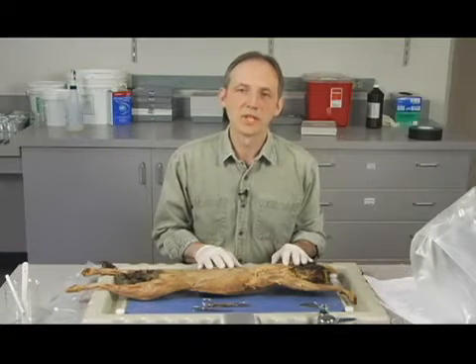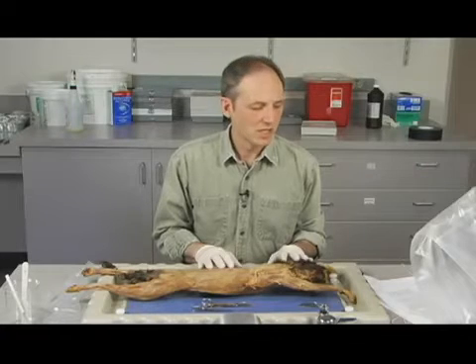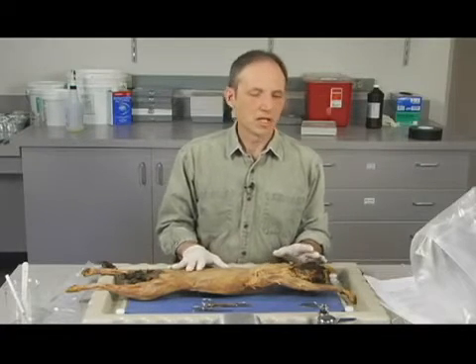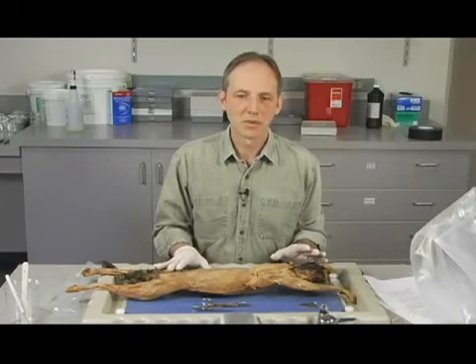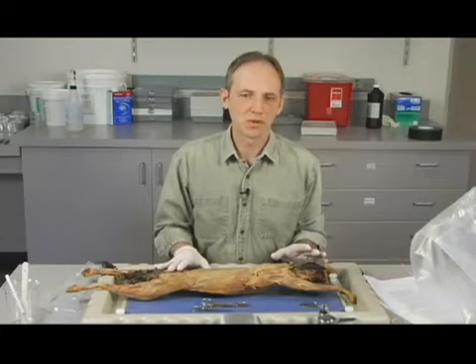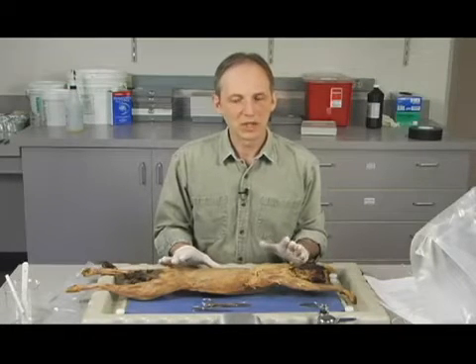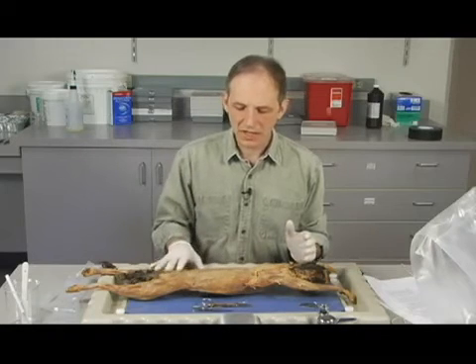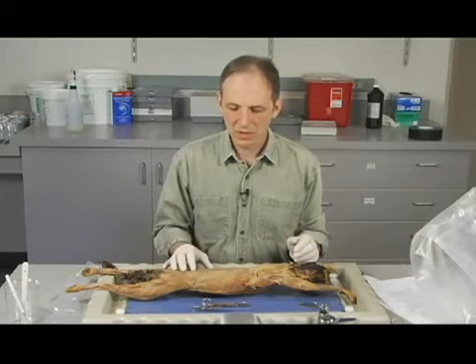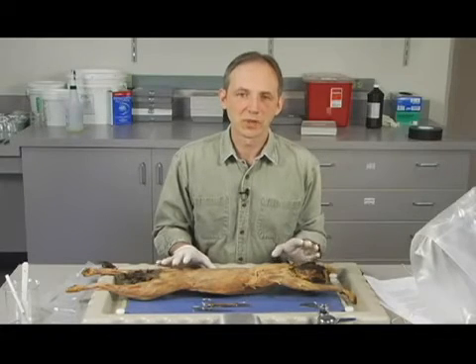You know, you're going to be new at this, and so that's definitely going to impact on how long this takes. Overall, this dissection process that we would do for the muscles would definitely take you several hours. Now, that might be one class period. It may take you 2 class periods to do that. But once you've done that and you've cleared off the connective tissue, you've identified the muscles, you'll be able to effectively study that for your exam.